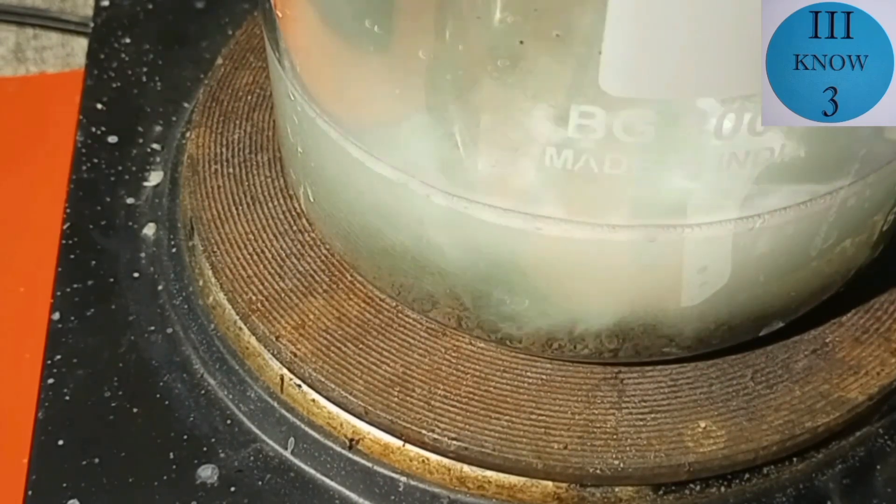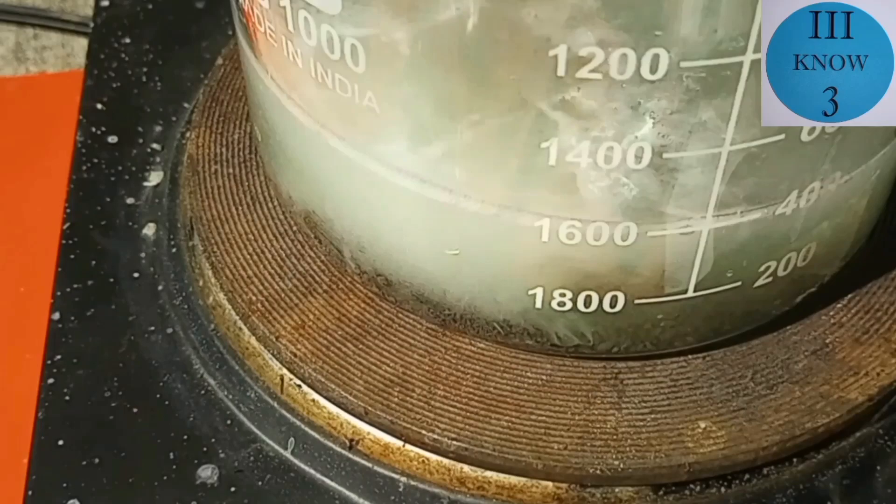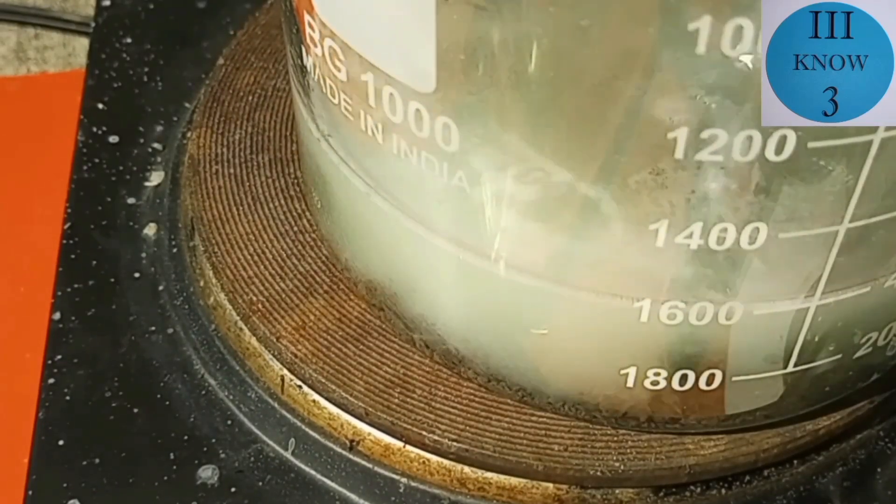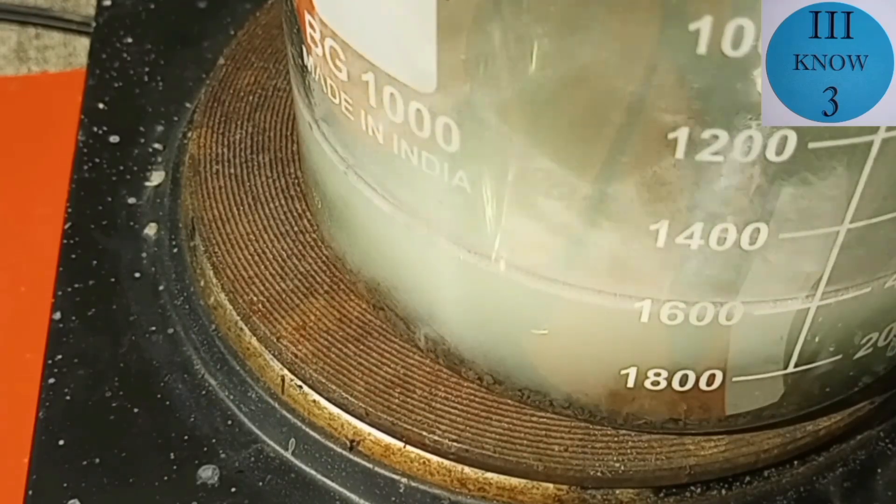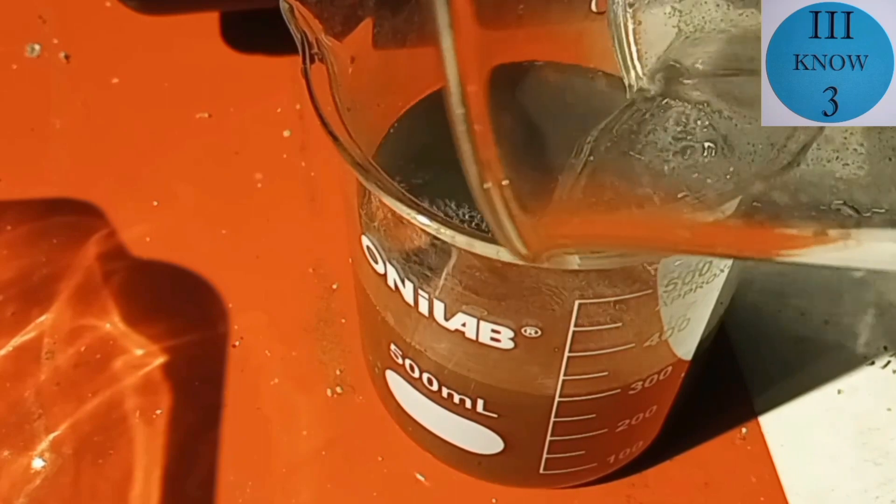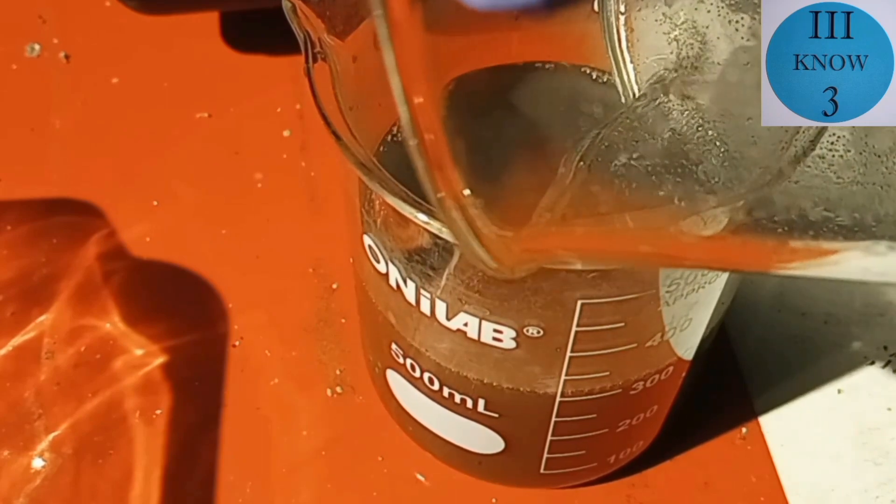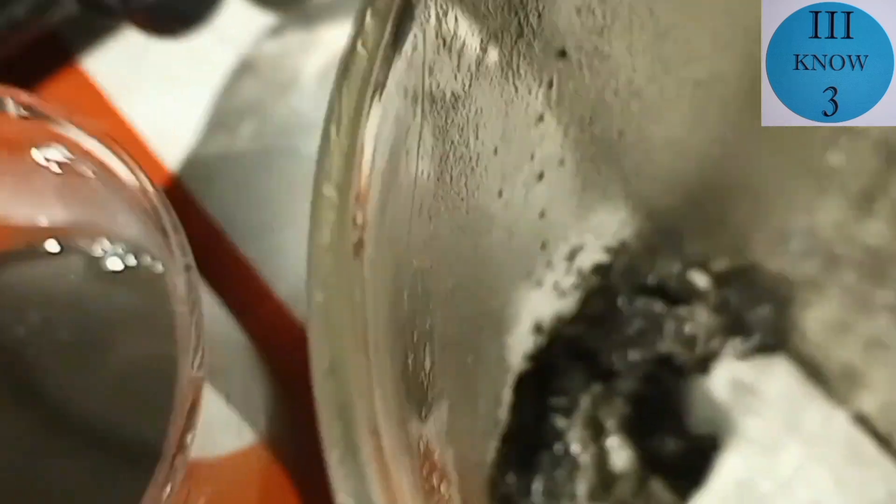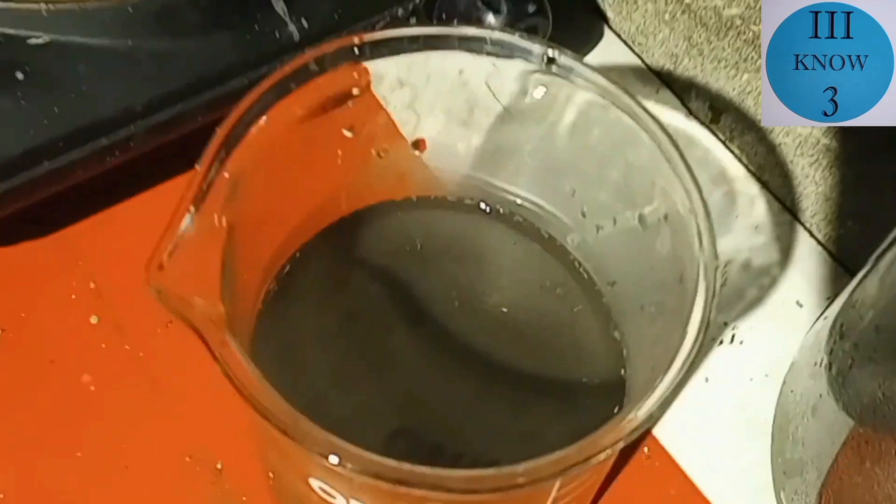Now the solution is getting pretty clear and there's a lot of what looks like precipitated out copper and nickel. So now we'll transfer this over into a smaller beaker. And you can see when I'm pouring it out, it appears to have a very dark color and there's the leftover zinc that did not get dissolved yet.